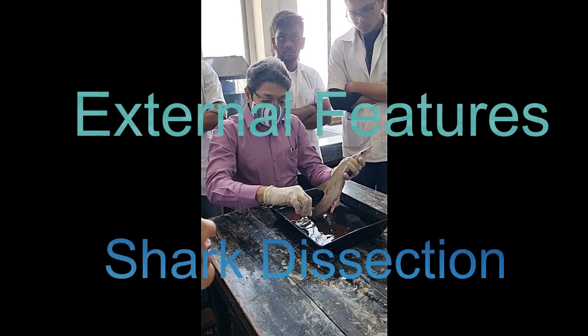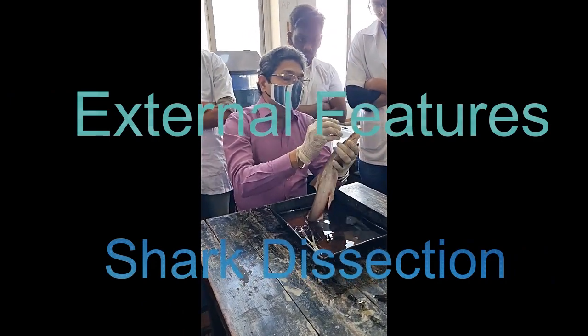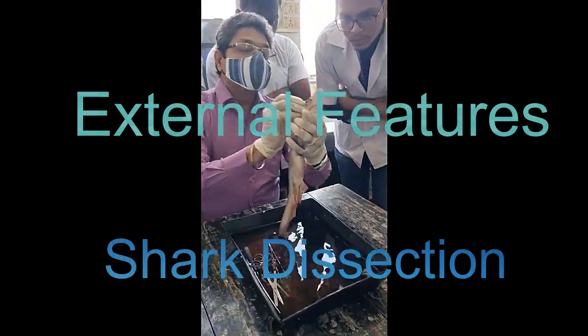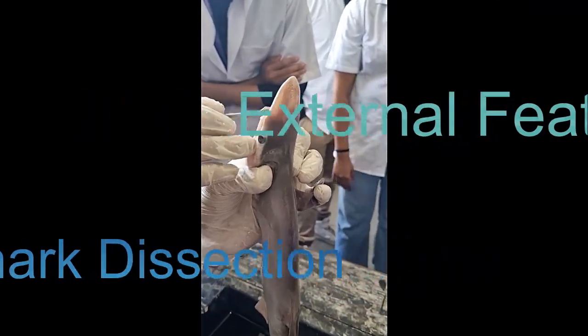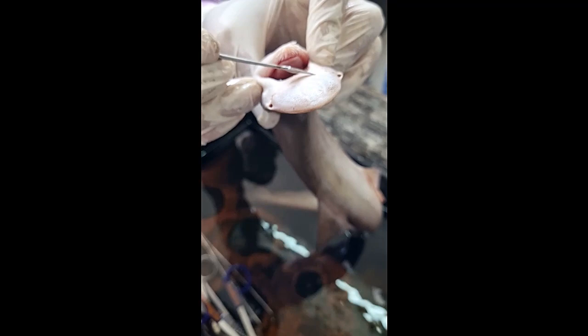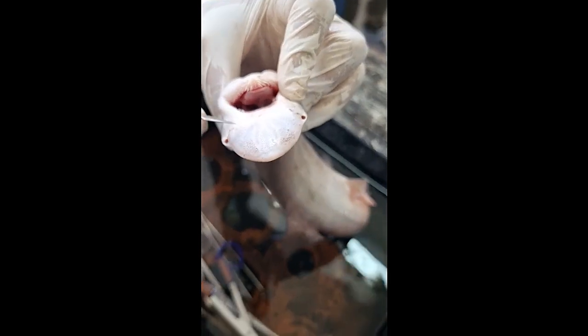You see these small dots, very small dots on the ventral side — these are also very visible here. These dots are nothing but the openings of the ampullae of Lorenzini, sensory organs.